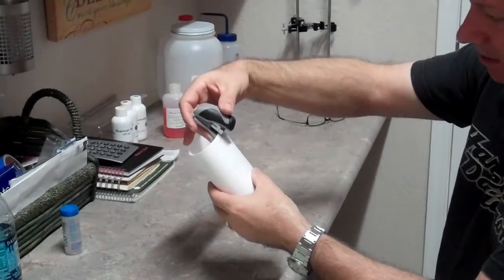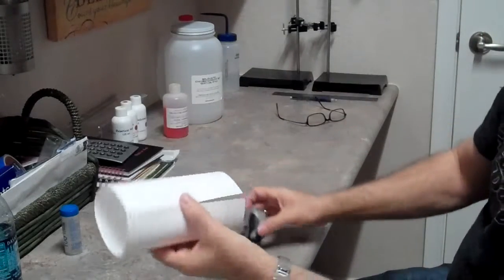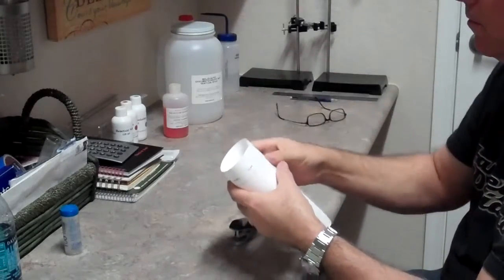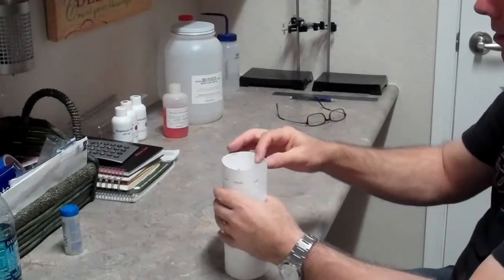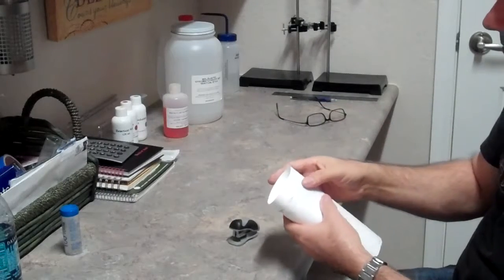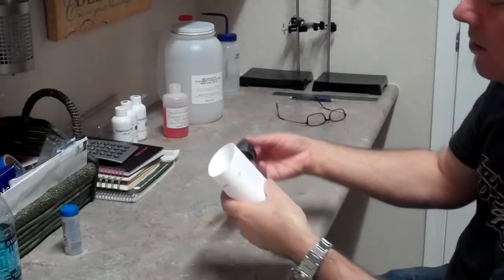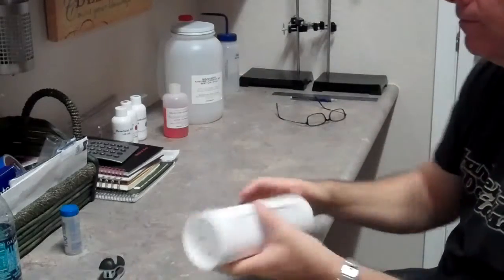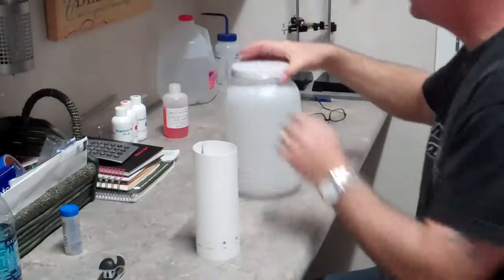We want to staple in such a way that catches half the paper on one side and half the paper on the other. I'm going to do that on both top and bottom, and that's going to create a nice cylinder so we can set it in our one gallon container.